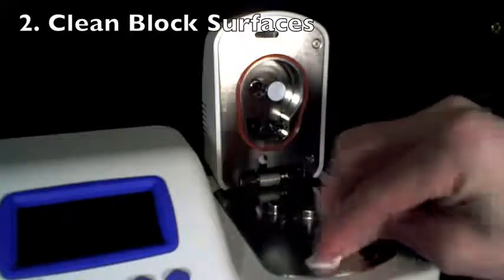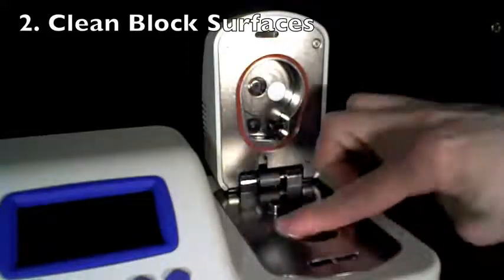Using a kimwipe, remove any debris that may have collected in or around the sample chamber.